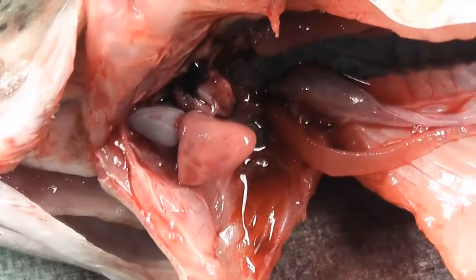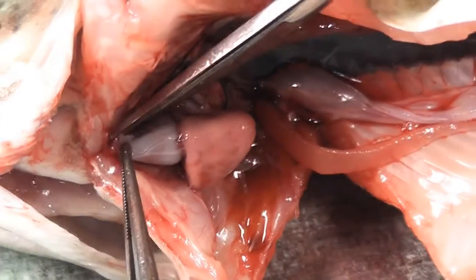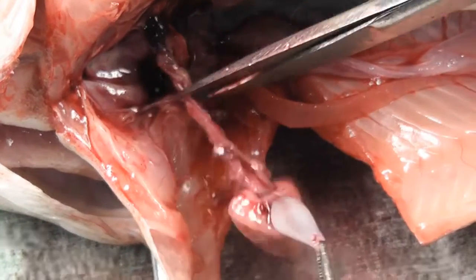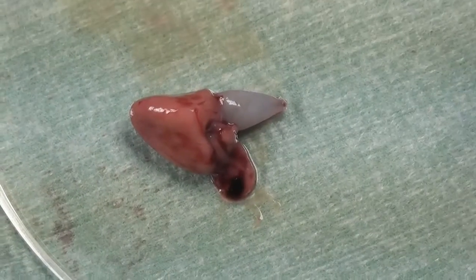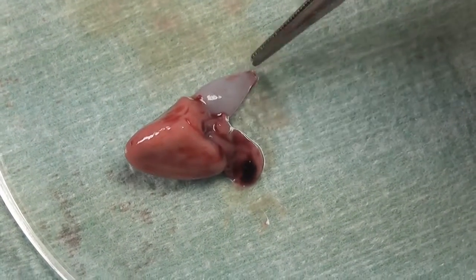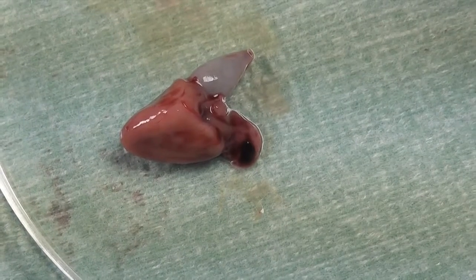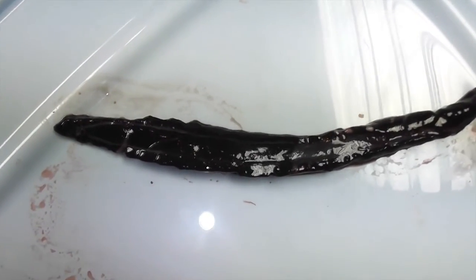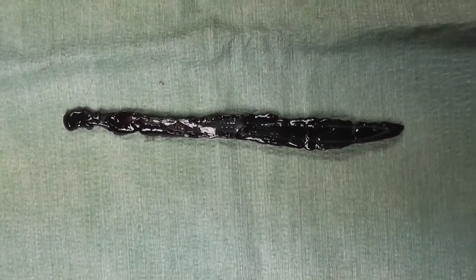The spleen is attached to the hepatic portal vein. This is the heart in situ, and now we remove the heart. The heart in particular is a muscular two-chambered organ that is primarily responsible for circulating blood, and this is the bulbus arteriosus on the left side. We can observe the kidney in detail, isolated from the rest of the organs.